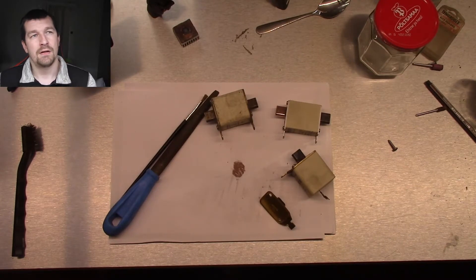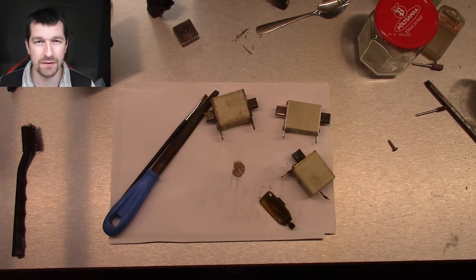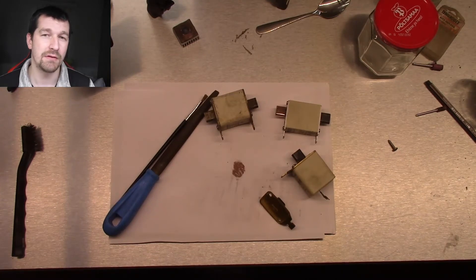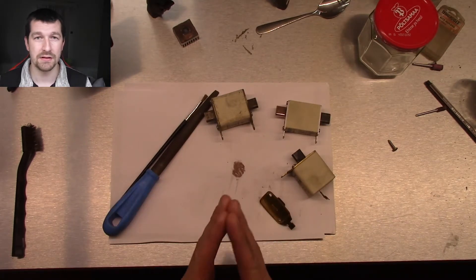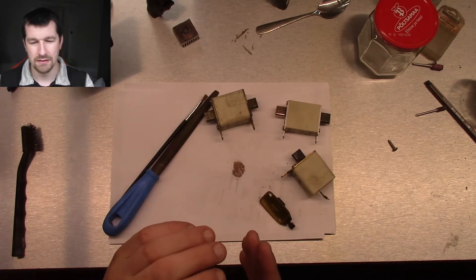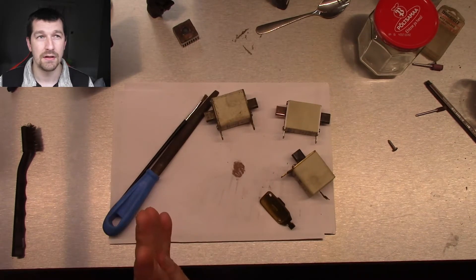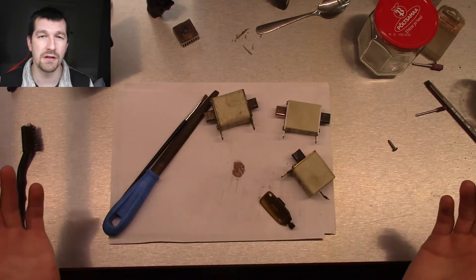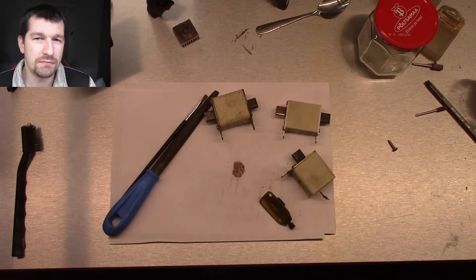Hello dear friends, I have been thinking a lot about how to recover silver from silver contacts. If we get lucky, sometimes some silver contacts are all the way nice and clean and pure silver, but quite often they are just silver plated on a copper core. That's the issue. People usually use chemicals or melt them and still use chemicals or whatever they do.